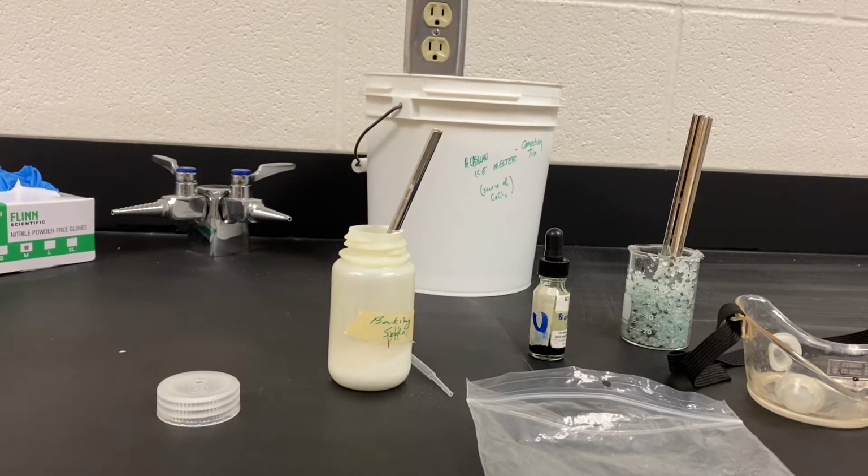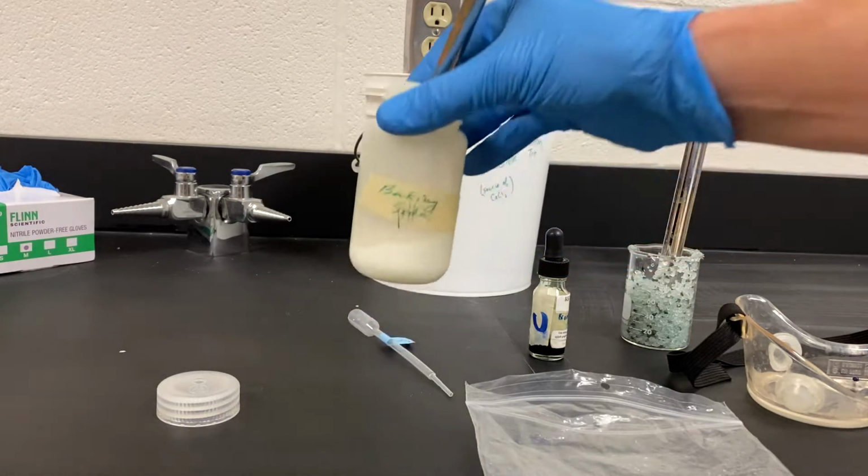We're going to work today on the identifying chemical and physical properties of substances investigation. You should have the sheet in front of you. It's a two-sided sheet. It starts with purpose, safety, materials. Your teacher will go through the beginning with you, and I'm going to show you the different materials you'll be using, and you'll be able to fill in the bottom of the sheet where those physical properties need to be listed. So our first substance we're going to use is baking soda.